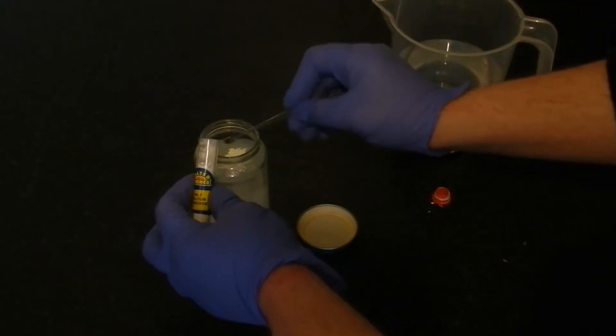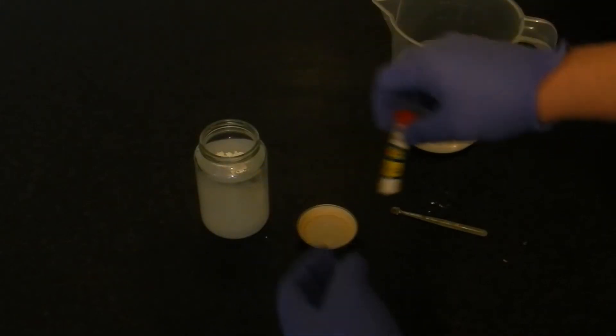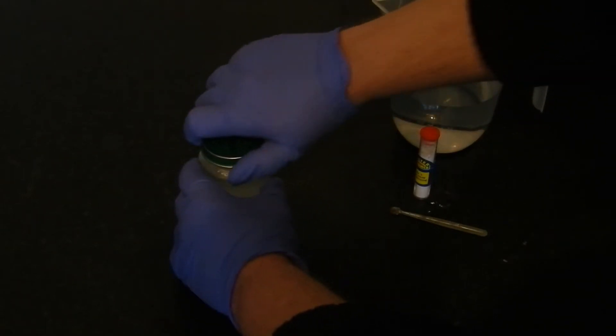Probably went a little bit heavy on the first one there. Now I'm mindful I don't want to waste too much of this and it is worth saying calcium hydroxide is corrosive, make sure you wear adequate protection when you are mixing it. So we're going to seal this vessel now, make sure it's properly sealed before we start shaking.